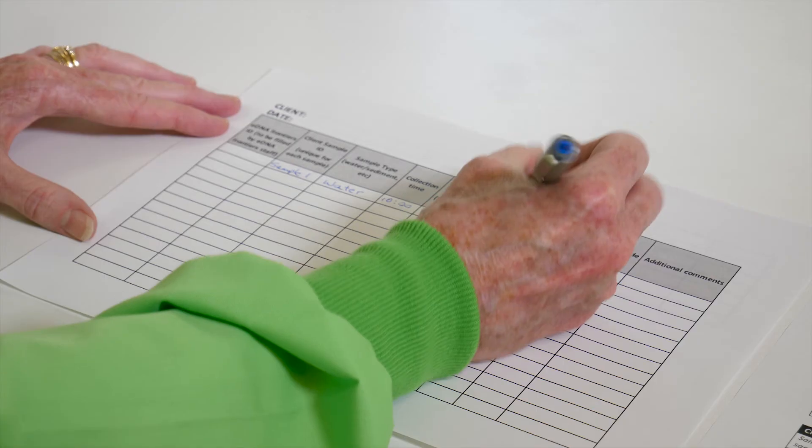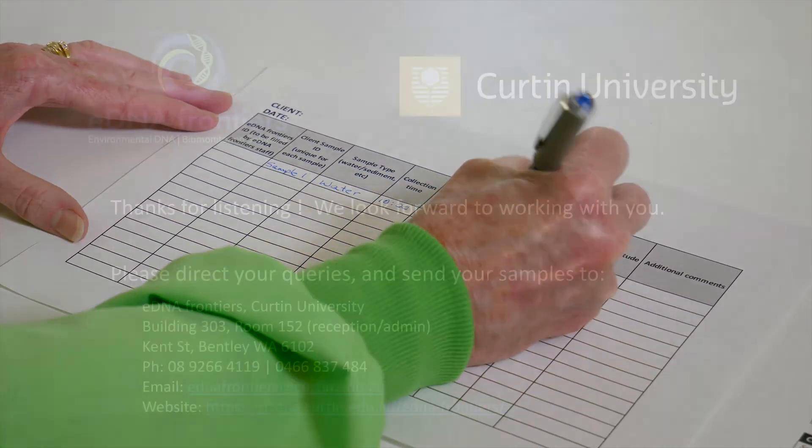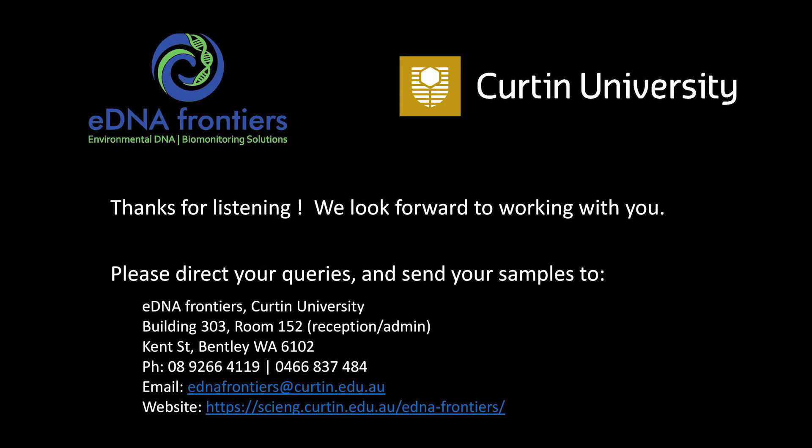Record all sample details under the sample submission sheet.